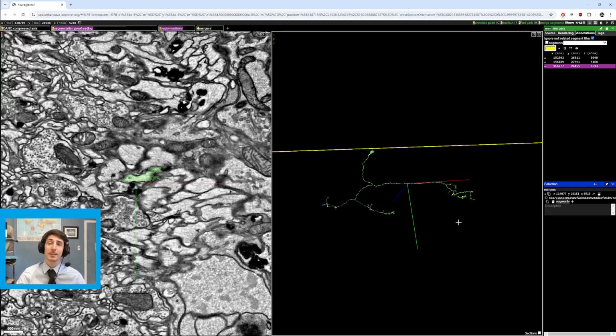What's going on, guys? Welcome back to another video, and today we have a video for Spelunker / Neuroglancer on how to spot a merger.